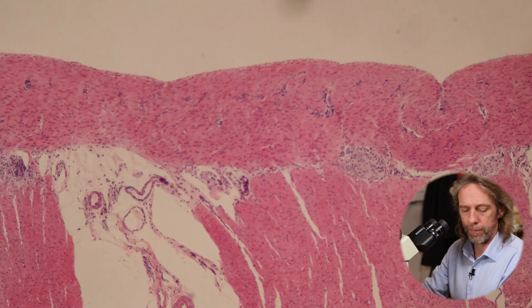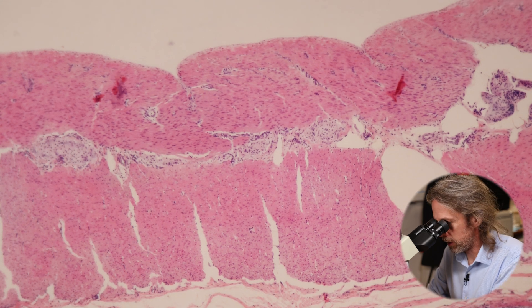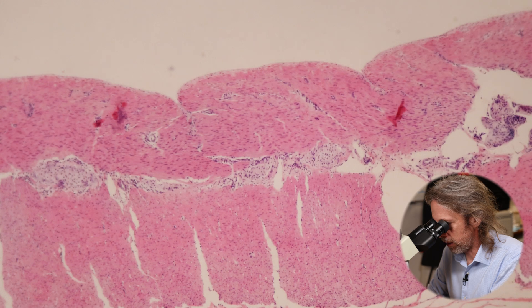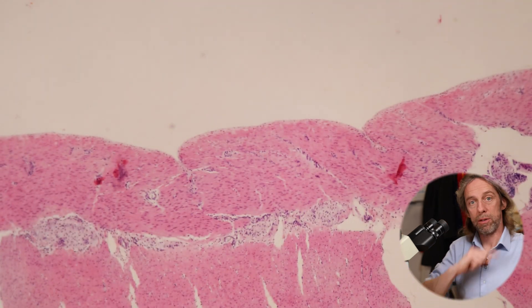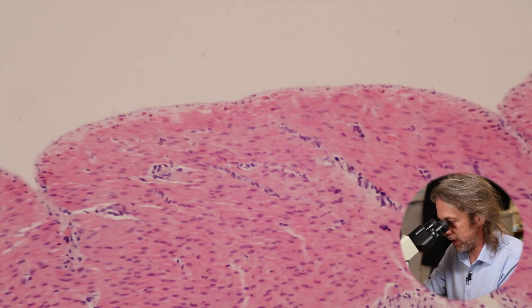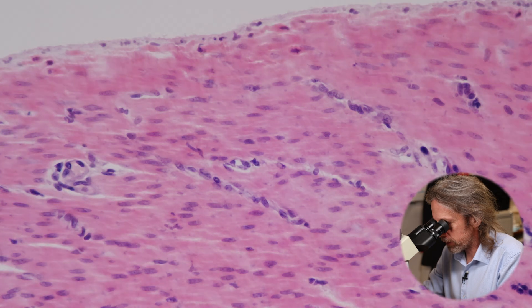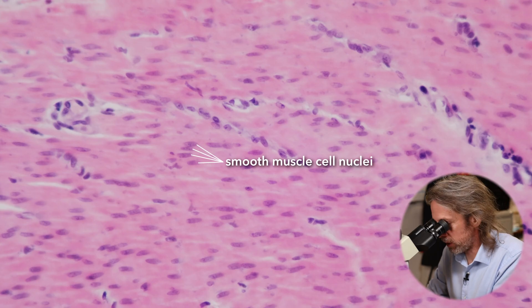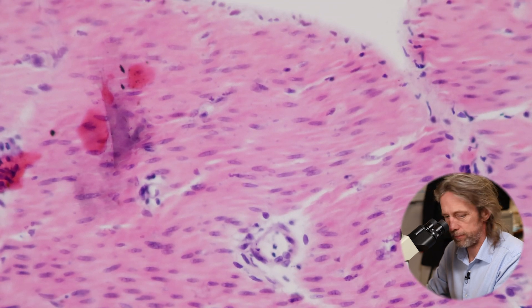Let's clean the slide. There are the two layers of muscle - the muscle at that end, in longitudinal section, is running the length of the large bowel, and the other layer of muscle is running around the large bowel. Jumping up to 20 times magnification - smooth muscle individual cells are very difficult to see, but we can see the nuclei quite nicely, which give us an idea of where the cells are.